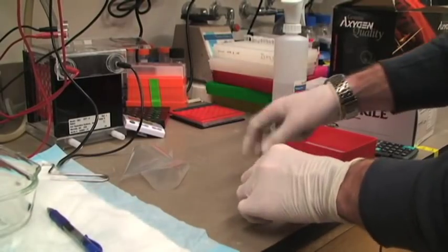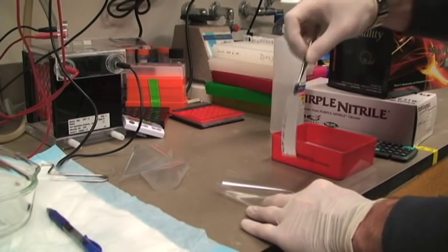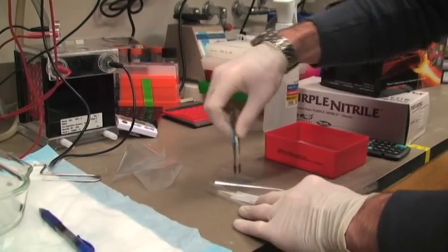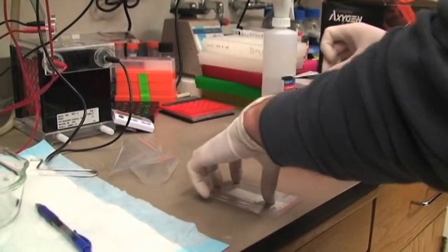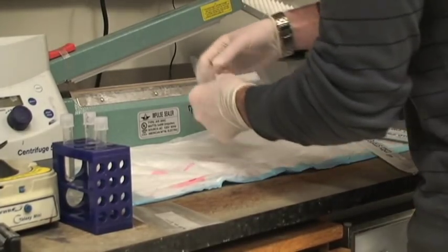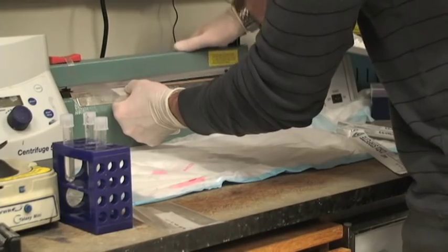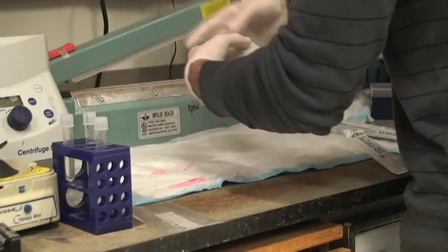Now Larry's going to incubate his membrane with the primary antibody. This is the antibody that specifically binds to the protein of interest. These antibodies can be very expensive, so to minimize the amount he'll need, Larry's going to seal the membrane into a little plastic baggie, minimizing the volume needed of the primary antibody.